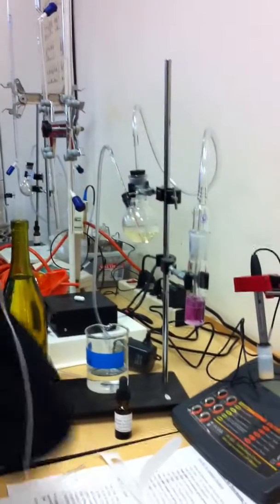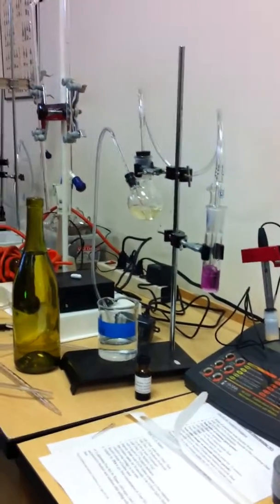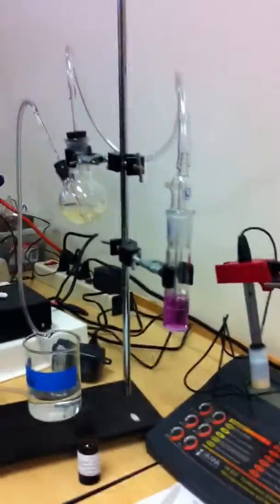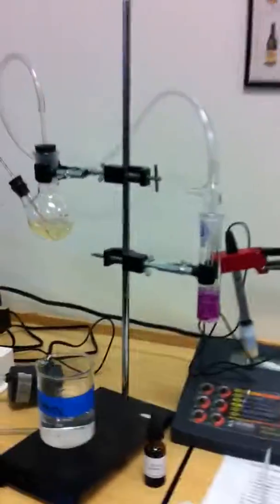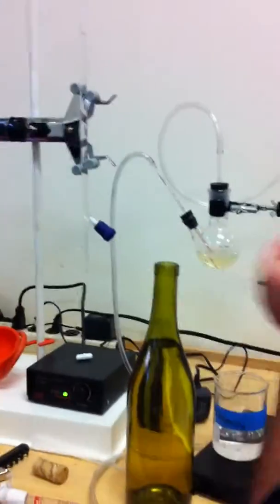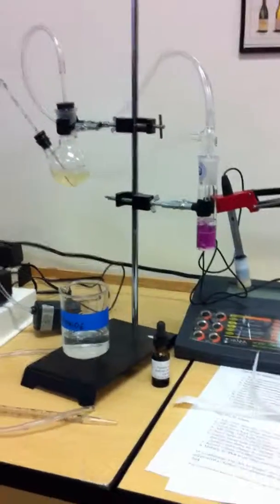So if somebody wants to go ahead and get started on another, you know, one of these other little ones, put wine in. Do you have more impingers to go in? We could make one. This goes on that side, right? So this goes on this side here. What we might want to do is give a sample of this and a sample of this.